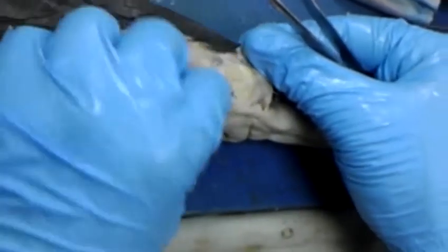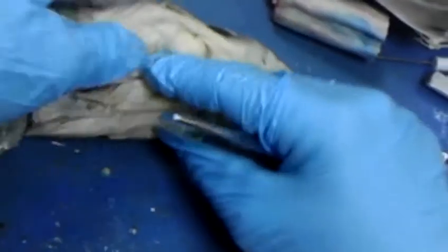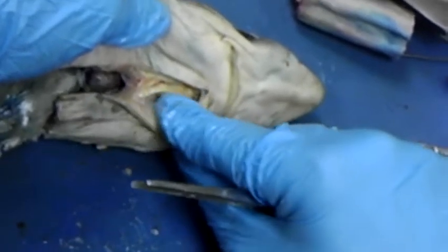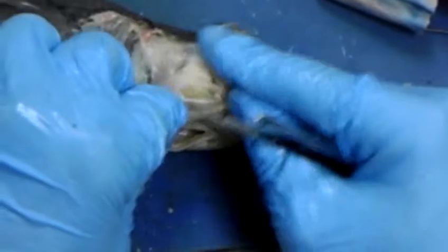And everybody's familiar with alligators, right? You don't want to get your hand inside of it when it clamps down because of the mandibular adductor. But you can hold that powerful jaw shut with duct tape, because that's where the power is. Look, how much power do you need to open the mouth? Not much. You need all your power to close it.